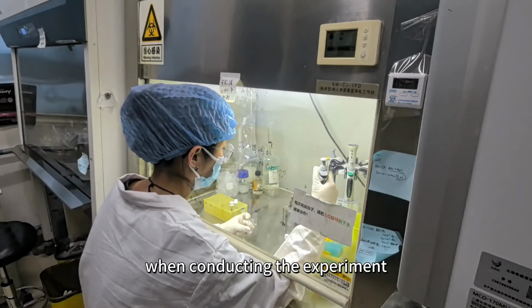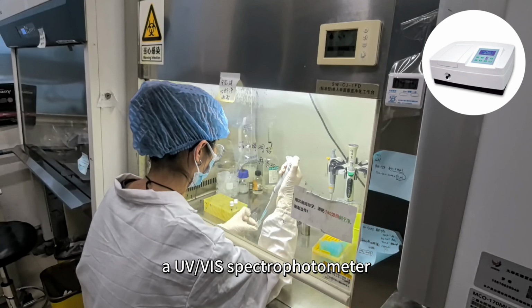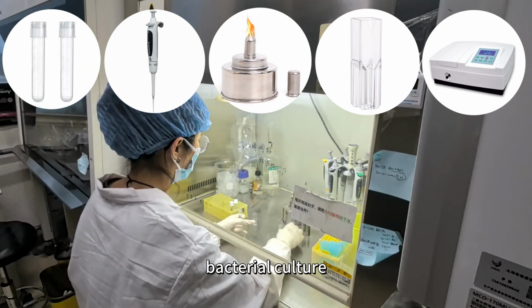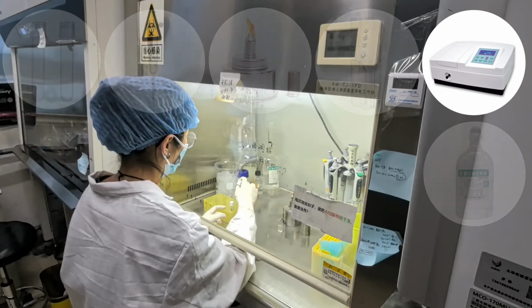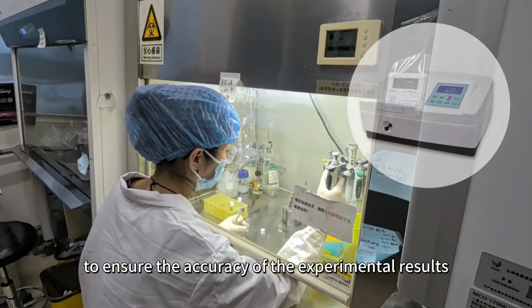Follow the steps below when conducting the experiment. First, gather the necessary equipment for the experiment: a UV-vis spectrophotometer, cuvette, an alcohol burner, pipettes, bacterial culture, sterile saline solution, and other required materials. Before taking measurements, the UV-vis spectrophotometer must be calibrated to ensure the accuracy of the experimental results.